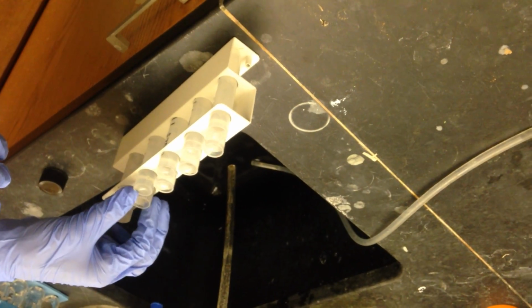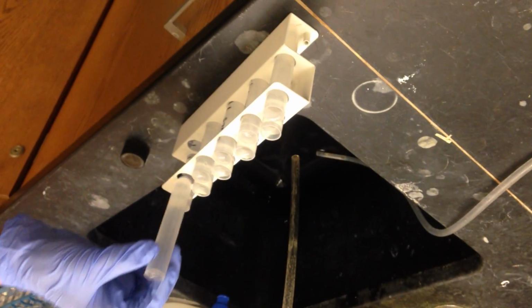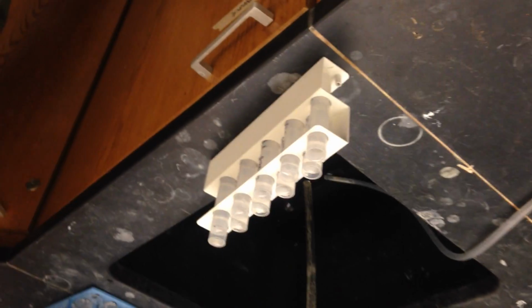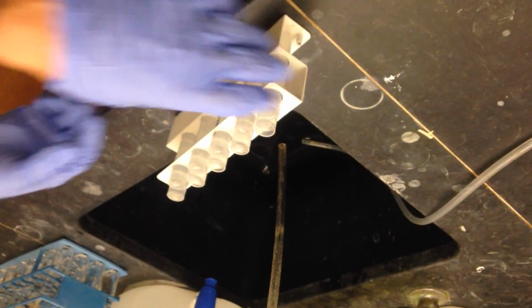For the lowest concentration, it's only one, right? Yep, DI water. There's a blank? Mm-hmm. So I usually have one blank cup that I use for calibration, and then highest, blank, and then the dilutions. I usually have one blank for doing calibrations, and then your blank 1 and blank 2 in the tray protocol. Oh, speaking of which, I need to change that.